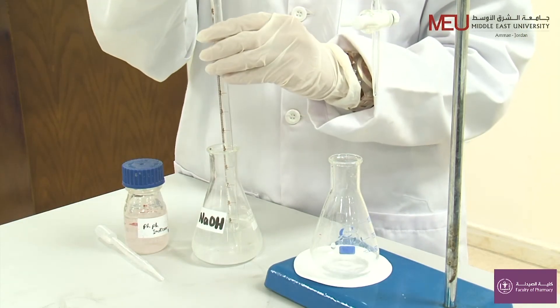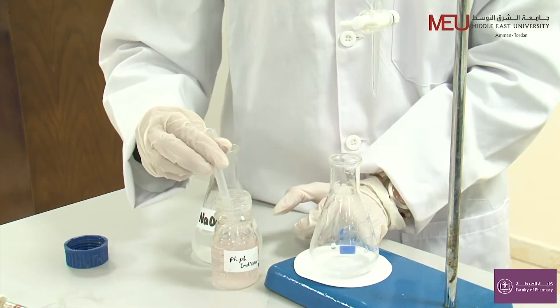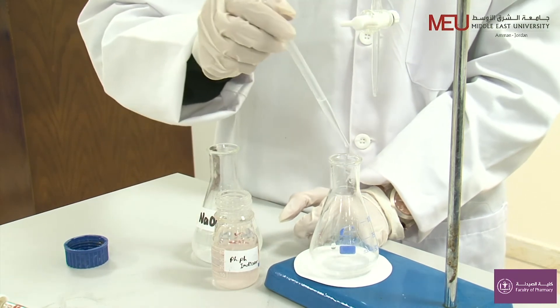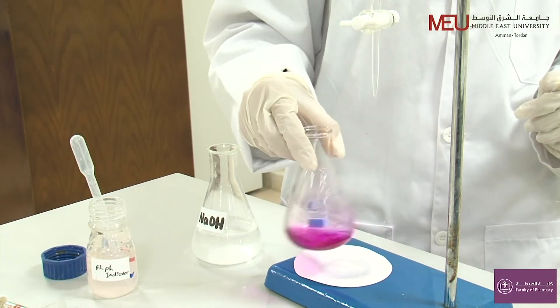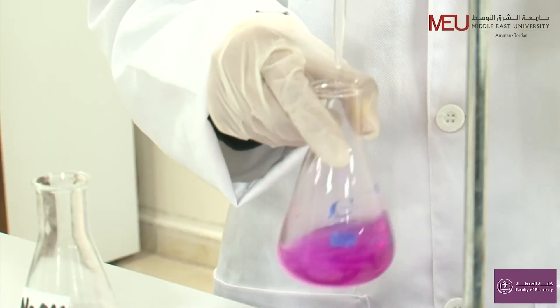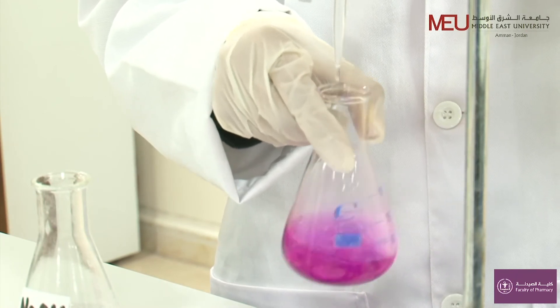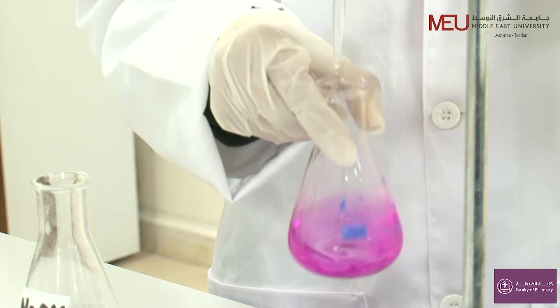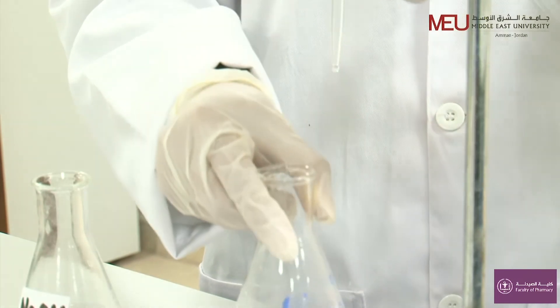Pipette 10 ml of Sodium Hydroxide. Add two drops of phenolphthalein indicator. Now we will start titration with hydrochloric acid. When the solution turns to colourless, we will record the volume and start our calculation. Thank you.